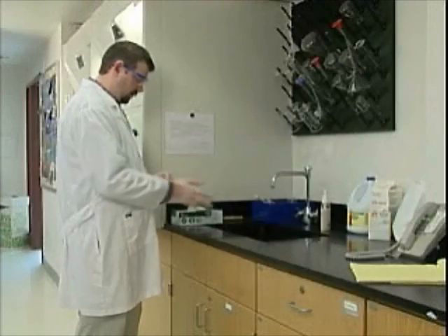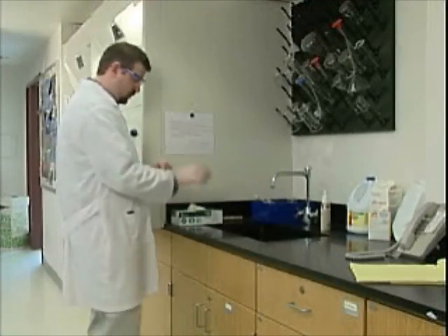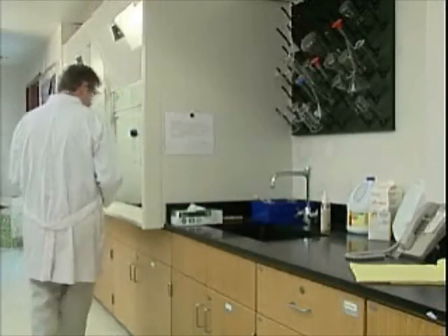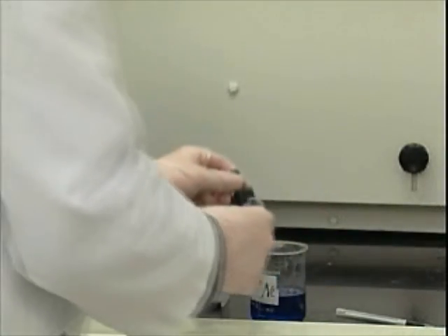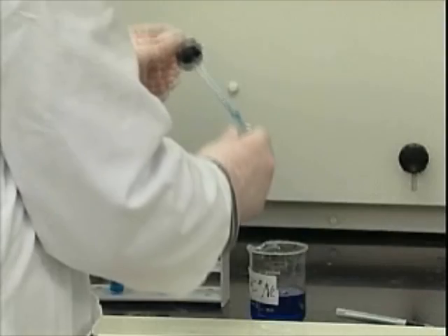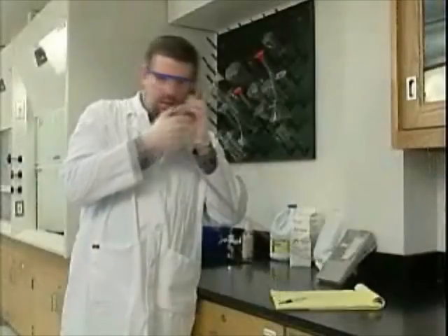Every day, we're called on to handle substances like toxins, corrosives, and carcinogens. We think we know how to protect ourselves, but are we doing all we can? Even tiny amounts of a hazardous material, combined with a few unconscious actions, can spread contamination. Let's take a closer look.